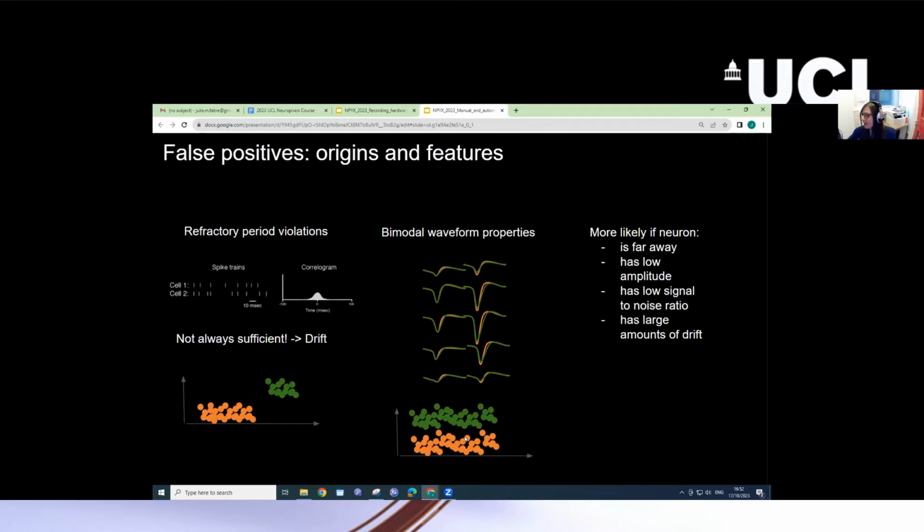And finally, false positives are more likely to occur if, this should say neuron, if a neuron is far away, it's going to be harder to distinguish from other neurons that are also far away. If it has a low amplitude in its waveform, if it has a low signal-to-noise ratio, and if it has large amounts of drift, like in this case.